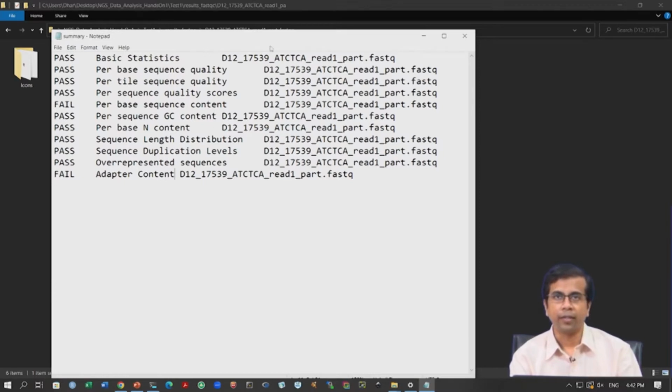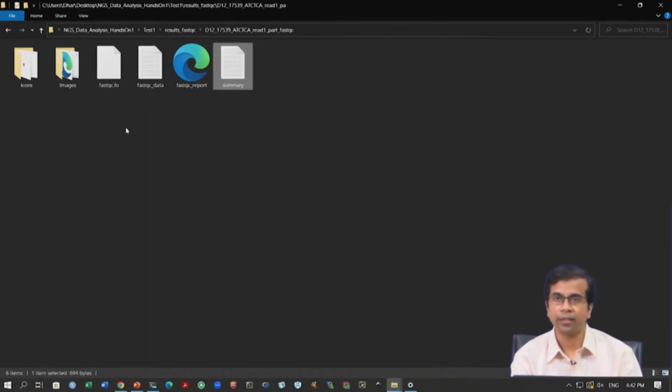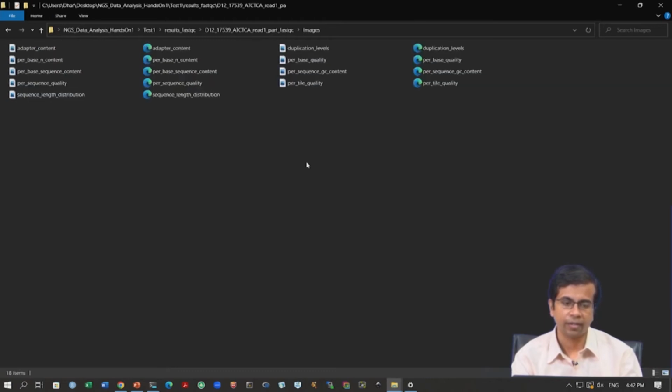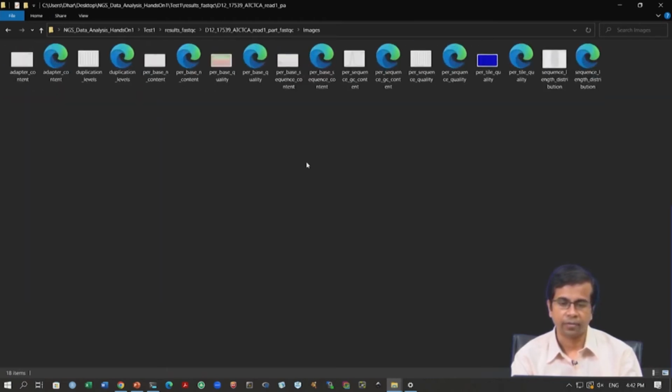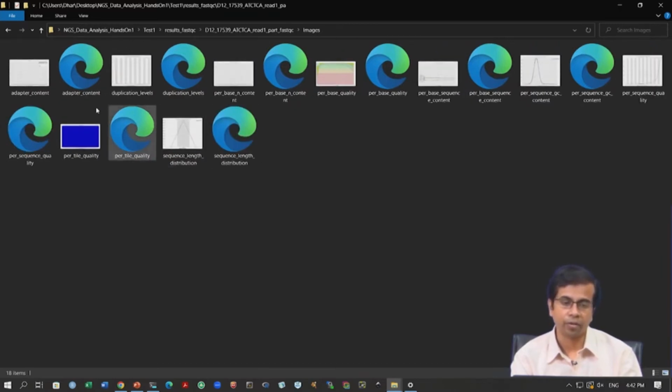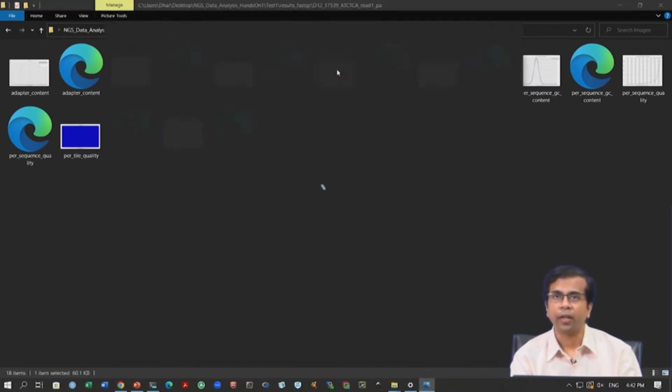So, let us now go into the images folder, keeping this in mind that there are two statistics for which we have this fail remark. These two statistics we will look into very carefully, but we can also look at the other ones. For example, we can start with this per base quality.